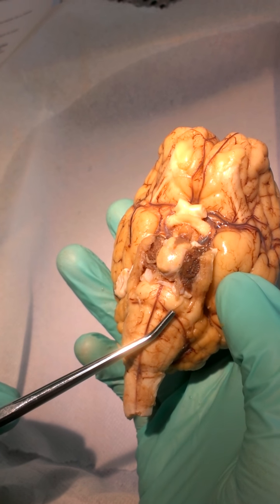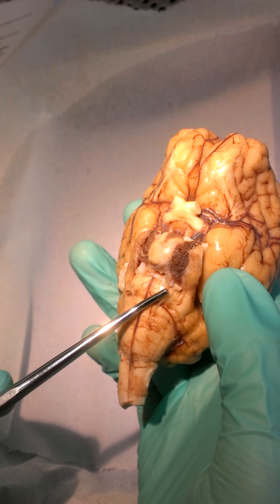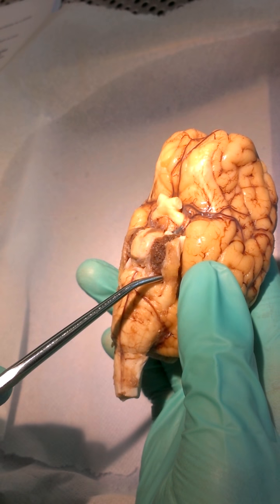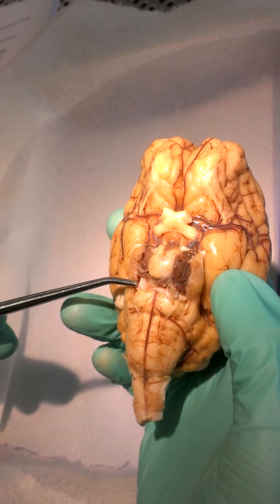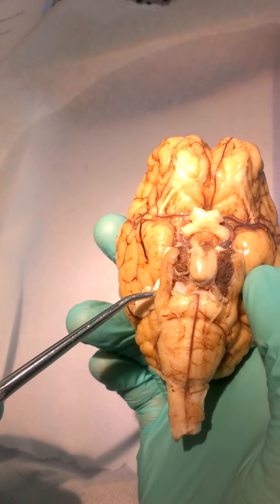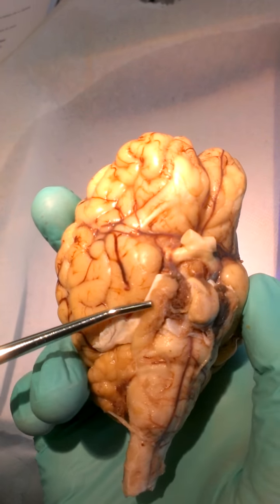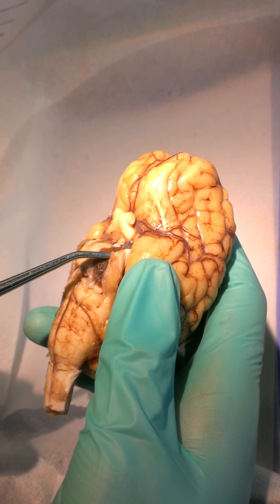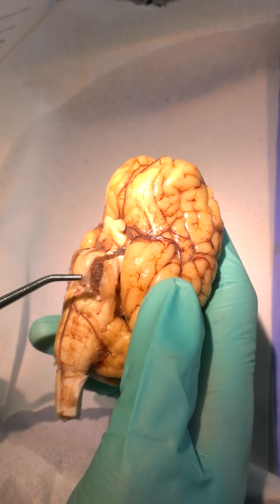Little strands, yeah, exactly. Those are the abducens nerve. The abducens nerve is really small. And then up on the sides, these really huge ones, these are the trigeminal nerves. They're both kinds of nerves, that's why they're so big. You see this right there, on both sides, bilateral? So that's the trigeminal nerve.